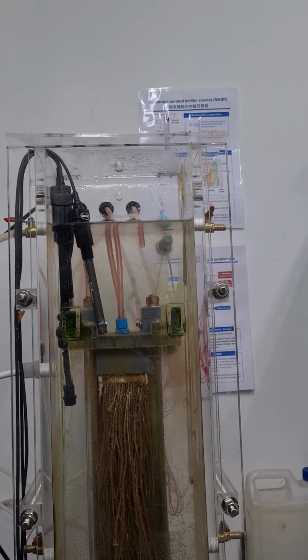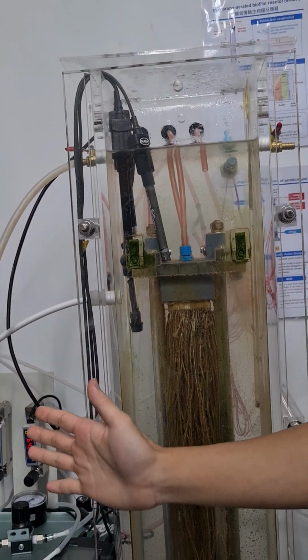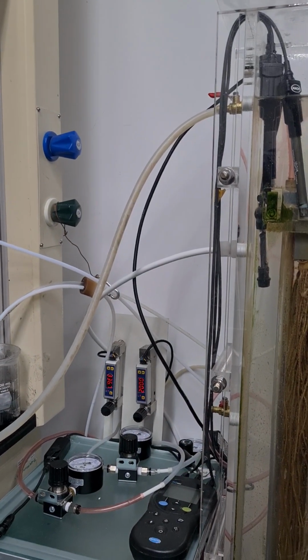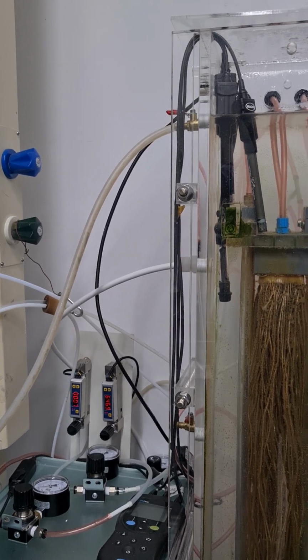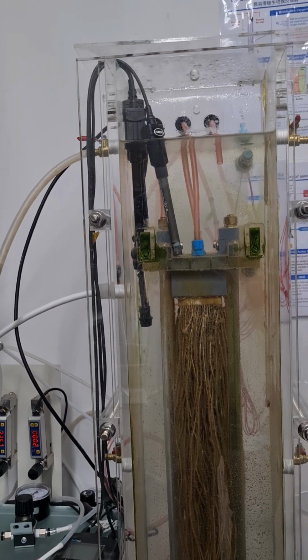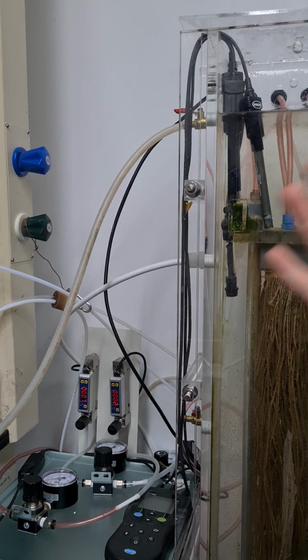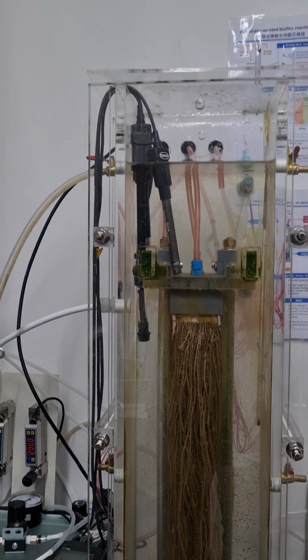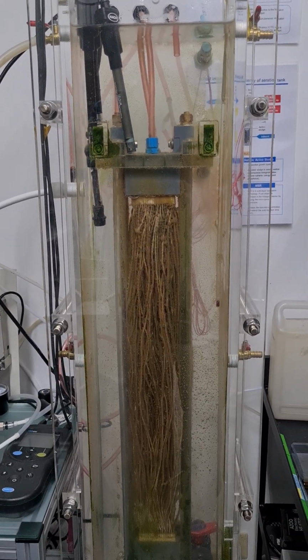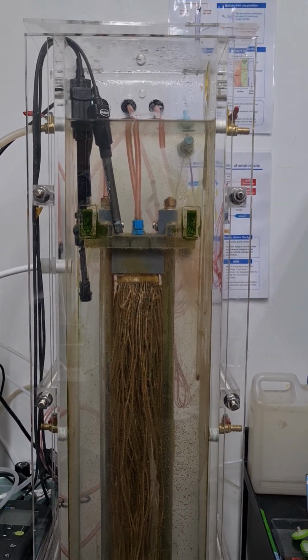Okay, I see. So what are you monitoring? Sure, we monitor aeration pressure and flow rate, and also pH, ORP and dissolved oxygen. Do you also measure carbon, COD? What parameters do you measure? But in our synthetic wastewater, there's no COD. So you don't measure the concentration of COD here? No, since we assume there's no COD. I see.